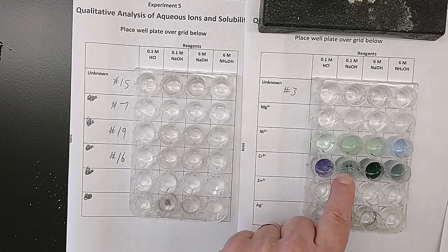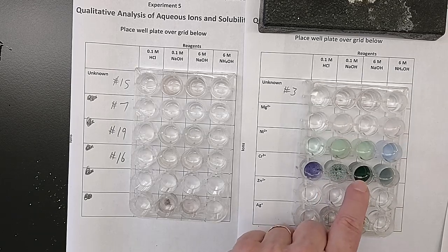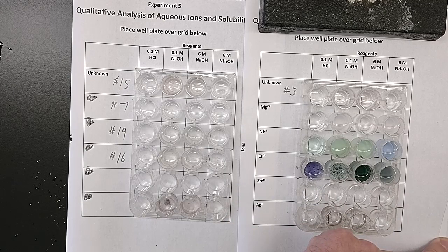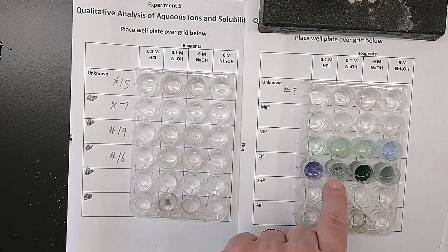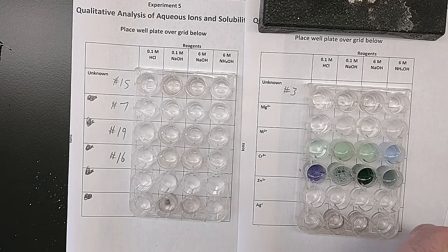So it went from purple, it turned color to green. The nickel started green and went cloudy to green. So I'm going to call this cloudy dark green. This one, if you look carefully, you can still see the line from the grid underneath it. So this is a clear, dark, even green. And then this last one is a cloudy green that's the same as this. So this sodium hydroxide and this ammonium hydroxide that's more concentrated look very similar, ignoring the foam. So I'm going to just call that a cloudy dark green, not cloudy darker green.